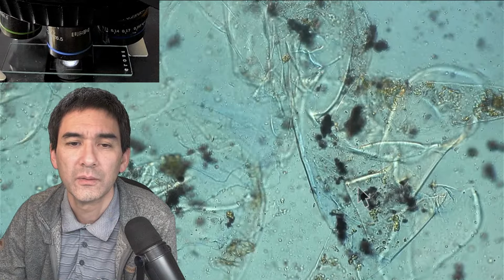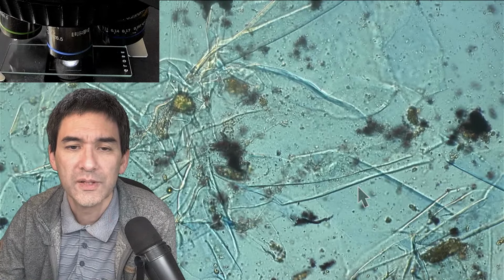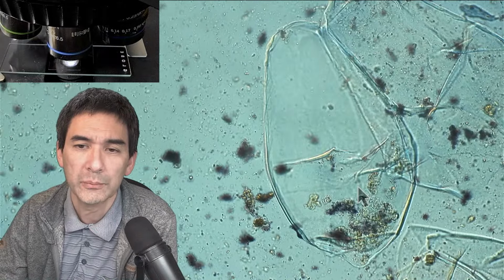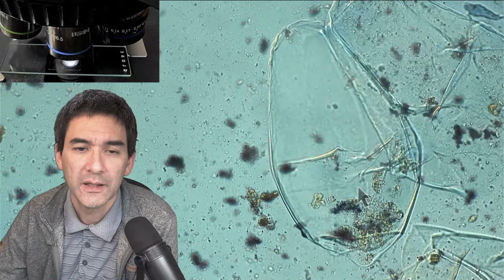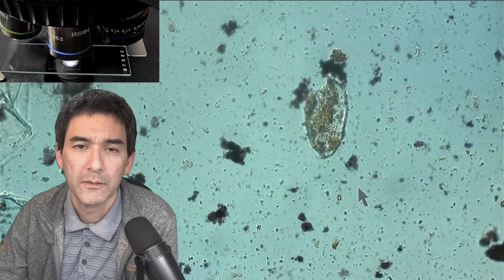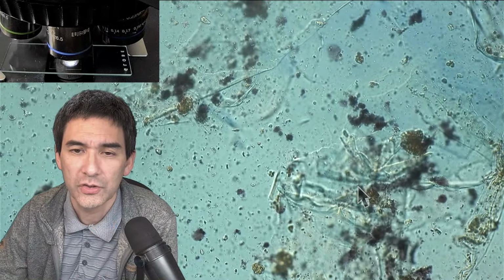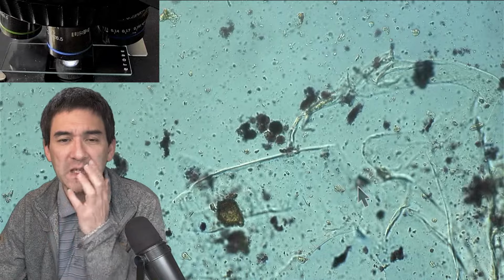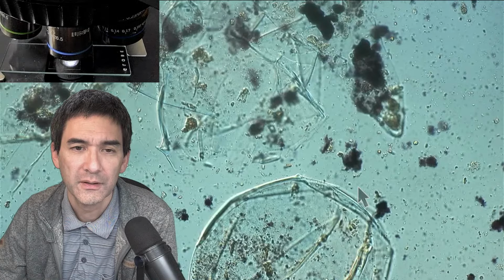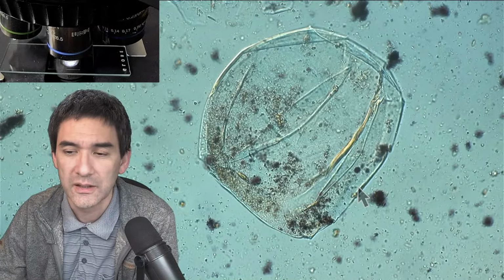Here there were too many of them together. But you will see that there are not many cells that actually contain those starch grains. So I can imagine that maybe due to the boiling process, many of the cells actually broke open, and this starch, of course, started to swell up. And not nice starch, just fragments. This is actually a bit of an indicator that the whole thing was maybe, how do you call this, mixed. Because here there's at least one intact cell, or at least it looks intact.